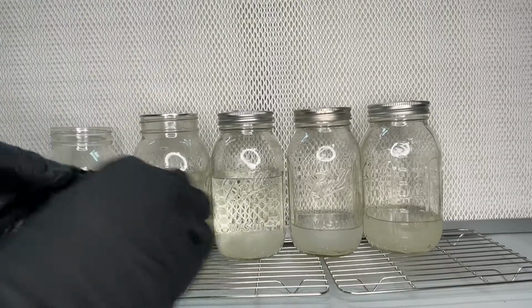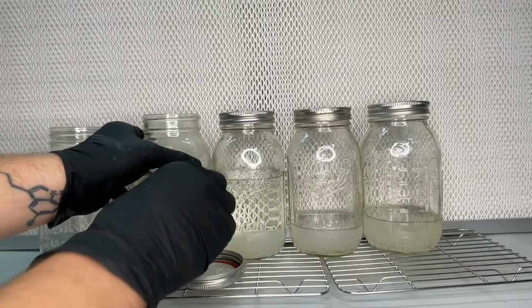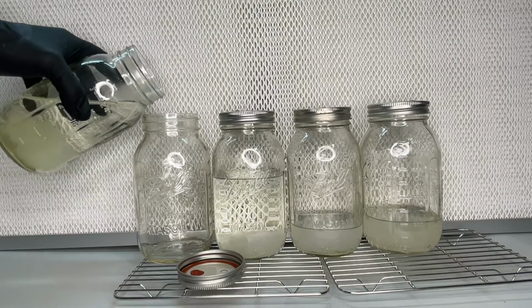I try not to shake the jar so that the mycelium settles at the bottom, and then I tilt the jar very carefully and dump out the liquid, leaving the mycelium behind.